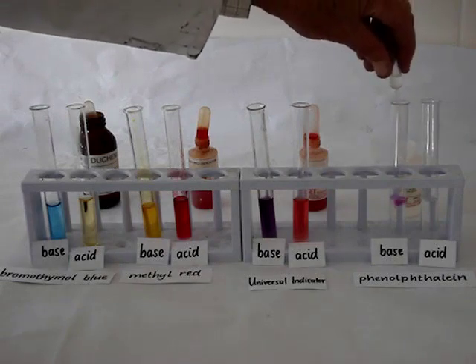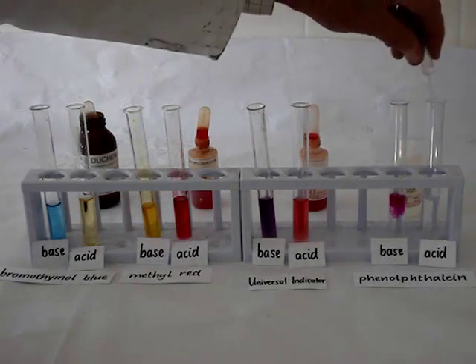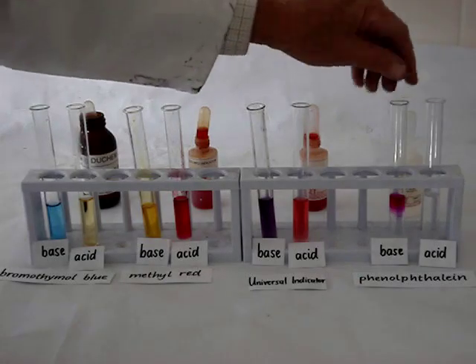Phenolphthalein — add it to a base and it turns pink. In acid, it remains colorless.